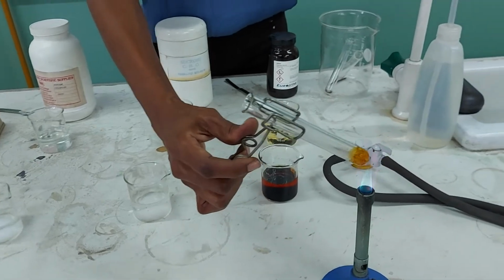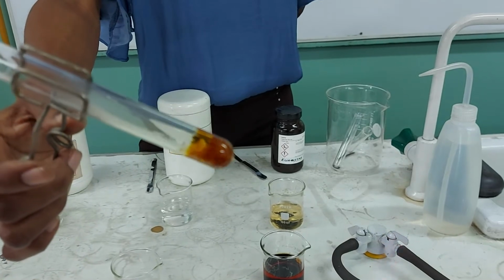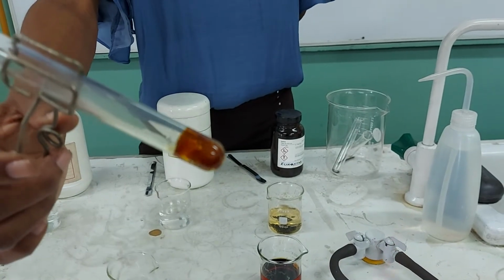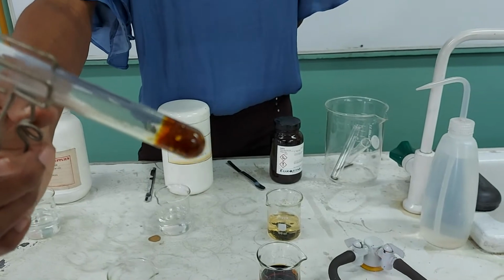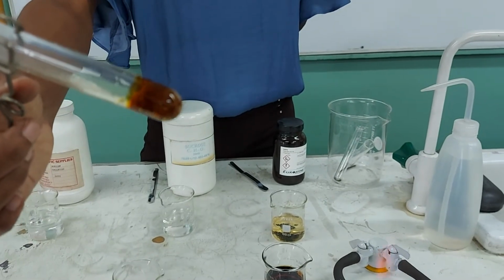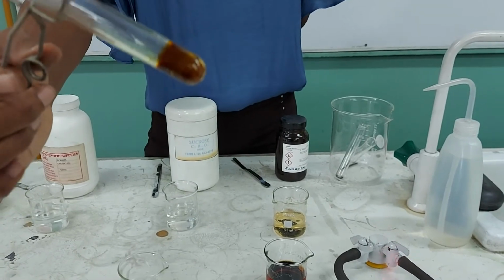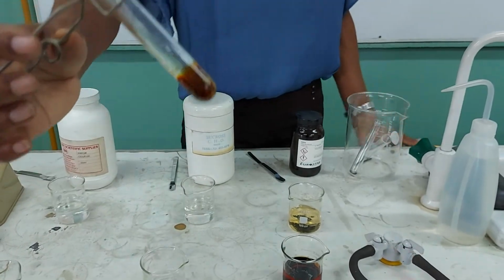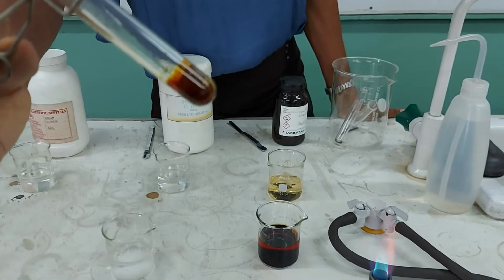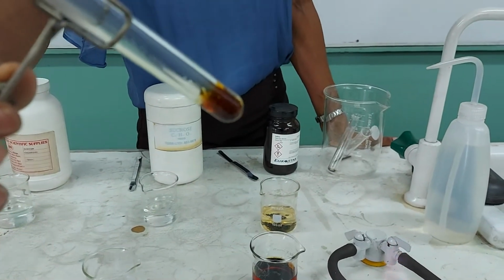You see the brown, and you want to make a note. This happens in cooking. So I want a name for that browning of the sucrose. Sucrose is our normal sugar, and there's a name for that process, especially in cooking. If you can put an explanation behind that in your discussion for me. But what we're supposed to look at right now is whether there were any changes on heating and what the changes that occurred would have been.